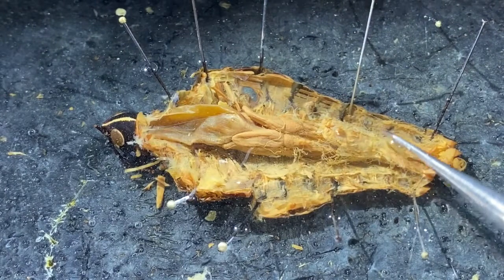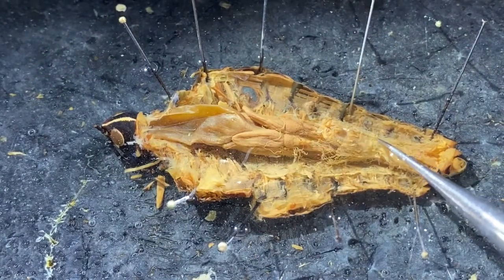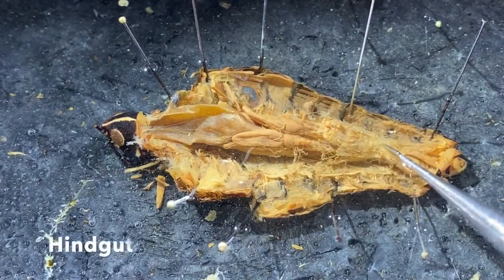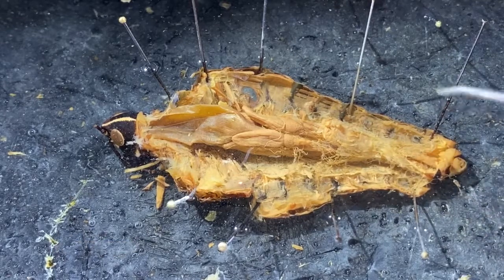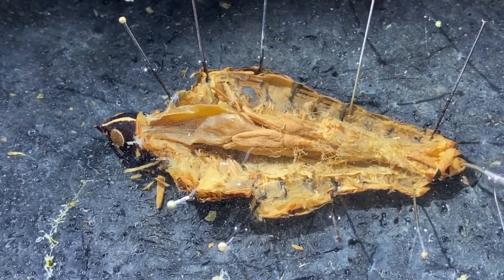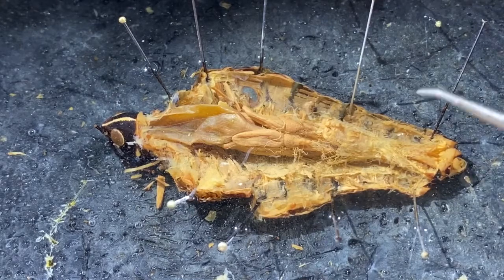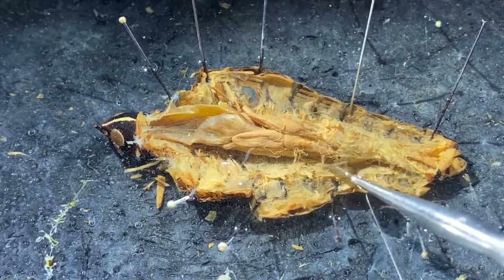And right around here someplace, we have a break between the midgut that goes from about here to here, and then we have the hindgut that continues from here back. The hindgut includes a rectum, where this animal creates its feces, and then the anus is terminal. It's the very posterior-most structure on the animal's body. And where the midgut and hindgut come together, it's a little bit easier to see up here.